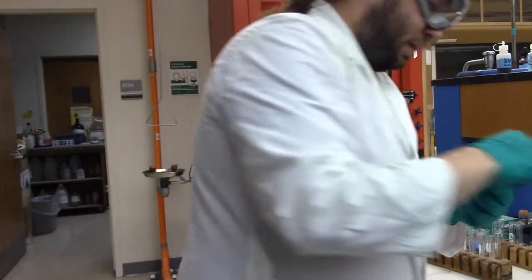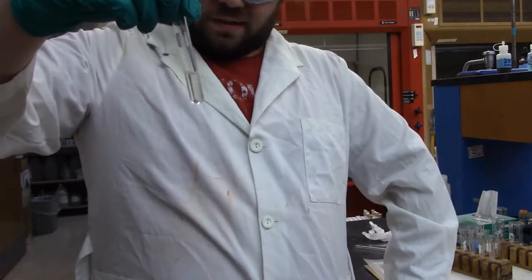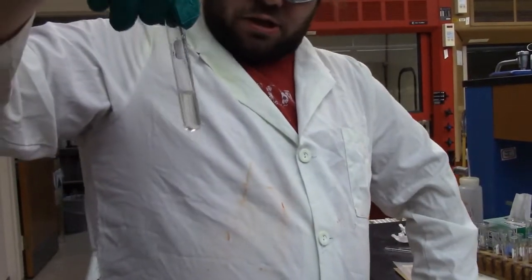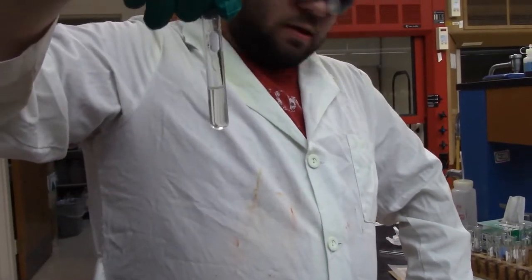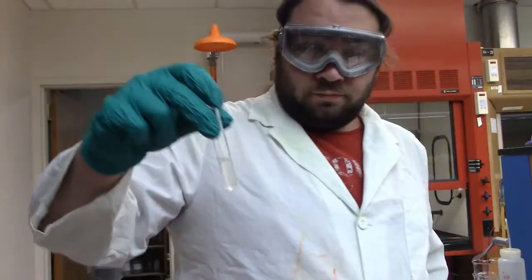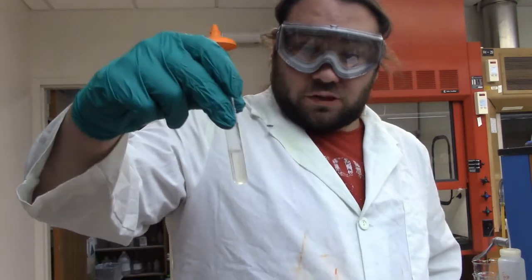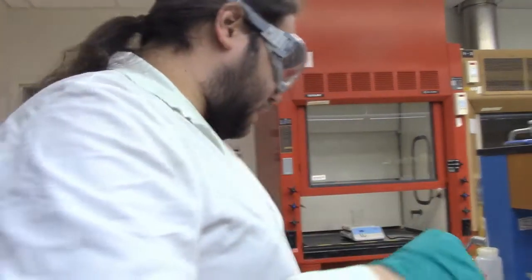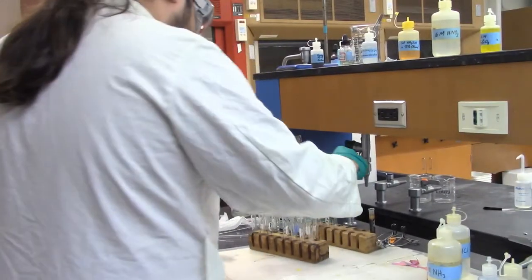And no major change, no precipitate. I'm still going to centrifuge it because it says so, but not much in there. So you guys can tell me, do we have chromium? I don't know. It's up to you to figure out. Alright, so just to go through the process showing you, I've centrifuged it. Not much change. So you guys can figure out if we have chromium or not.